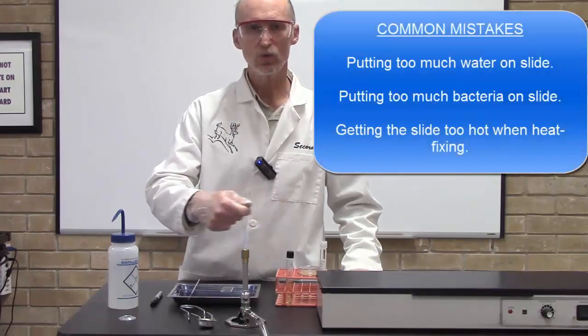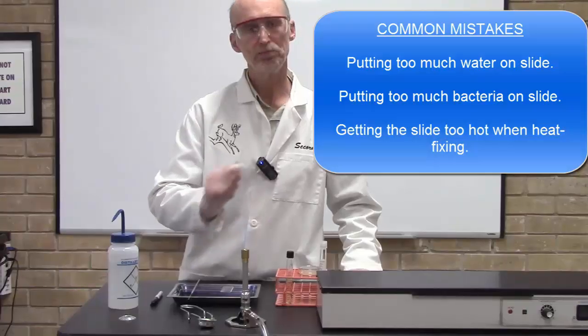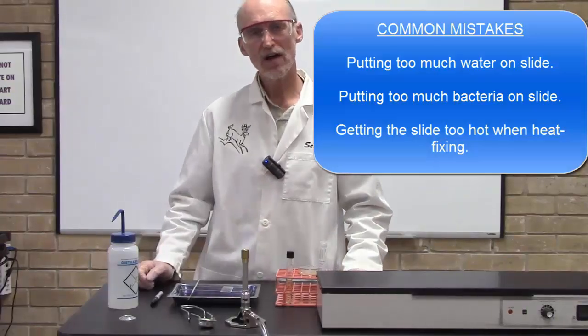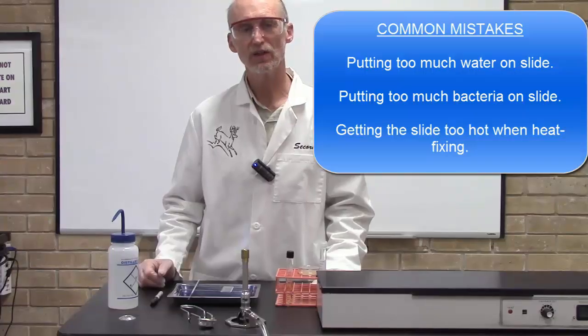I mean, you just need to pass it through: one, two, three. So there you have it. That is how you perform a bacterial smear.